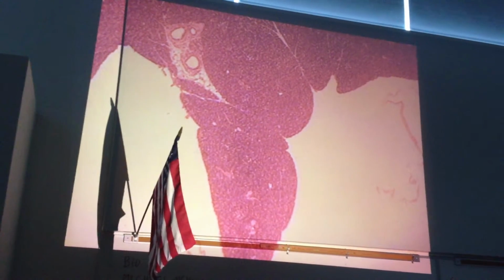All right, 2 more. Next one is pancreas. Most of the pancreas, when we look at it, is very dark looking, and the individual clusters of cells there, a single one is called an acinus. Collectively they're called acini, or they're called acinar cells. And I made note, we'll look at those and talk about them in part 3 in the histology. We won't do it here. We're interested in finding these light-staining regions where hormones are made in the pancreas. And they're called islets of Langerhans, and you can see it.